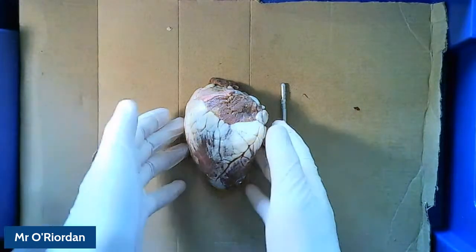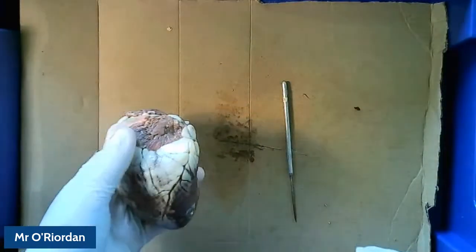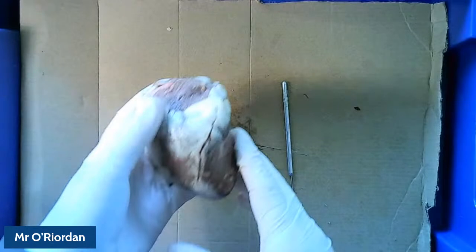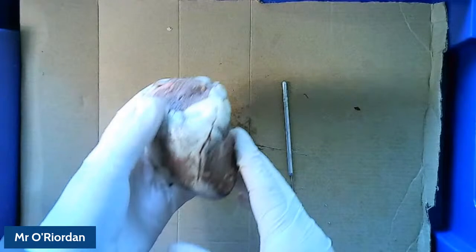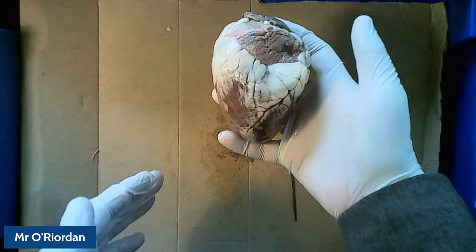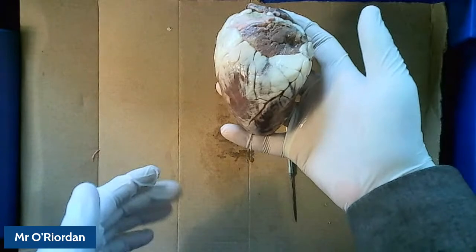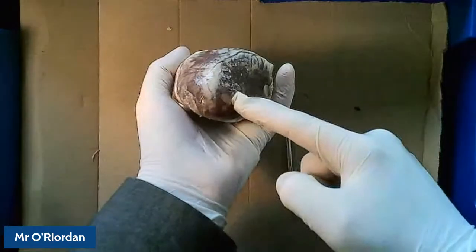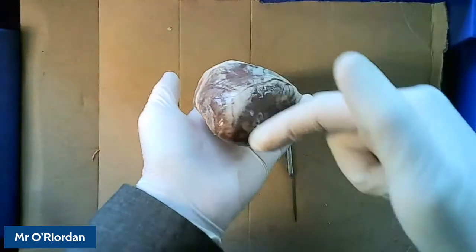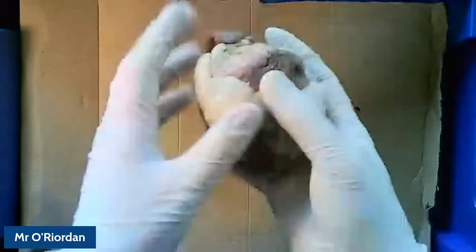Here, as Miss has already described, we've got our heart. I'm going to start by identifying the thicker side of the heart — as you can see from that angle it's not quite symmetrical — you've got a much more muscular side. I'm going to turn it to the base and start my incision here, working all the way around like it's a bread bun, just to get a nice cross-section cut straight through the middle. Bear with me for two seconds while I do that.